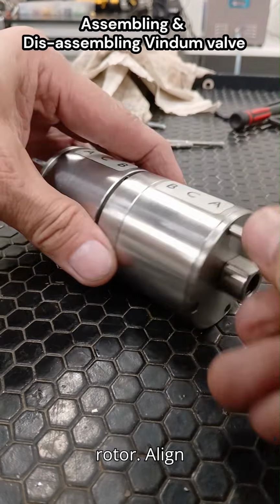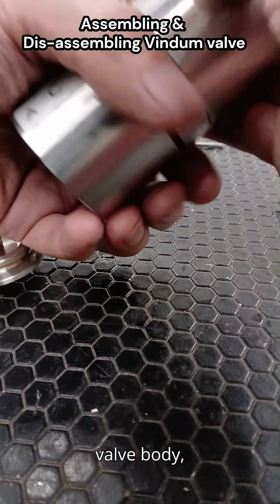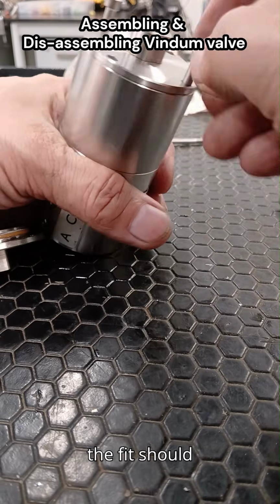Insert the rotor. Align rotor flow channels with the correct port positions, referring to the diagram or position chart. Carefully lower the rotor into the valve body, avoiding contact with sealing faces. Do not force, the fit should be smooth.